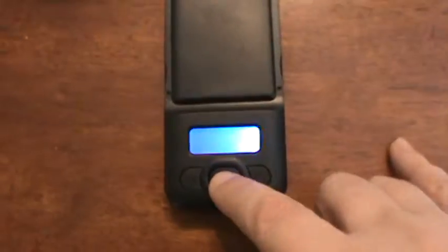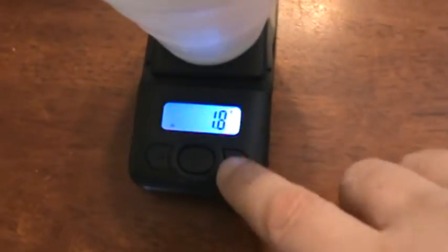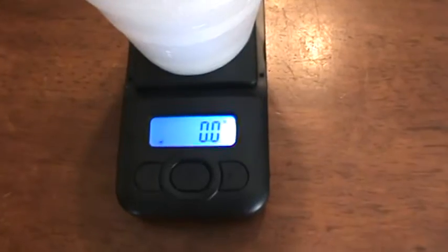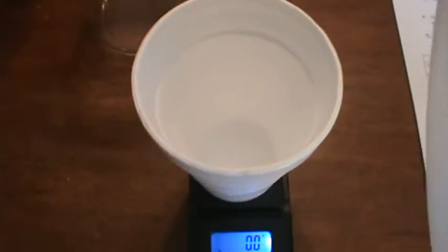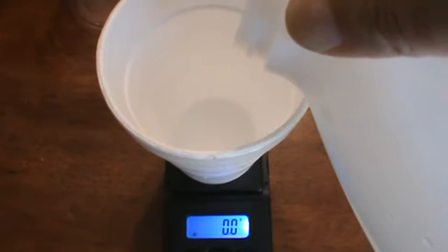Okay, so I have my little scale here again. Okay, and into this I will be pouring some more vinegar. So I'm just going to zero this out with the styrofoam cup on it. And if anybody's curious, these are actual styrofoam cups from work because I don't have styrofoam in my house. And the interesting thing is that these styrofoam cups are the same styrofoam cups that we have used for this lab for the last 16 years. We save them and we do not waste them.